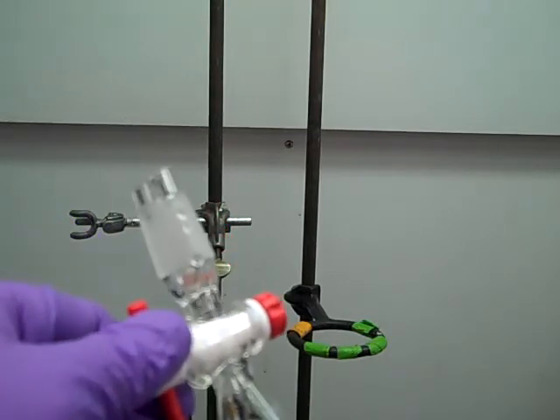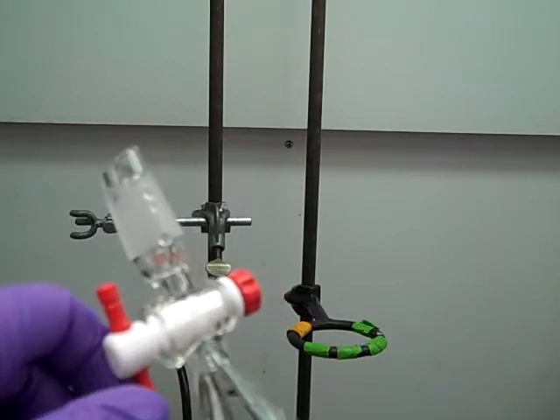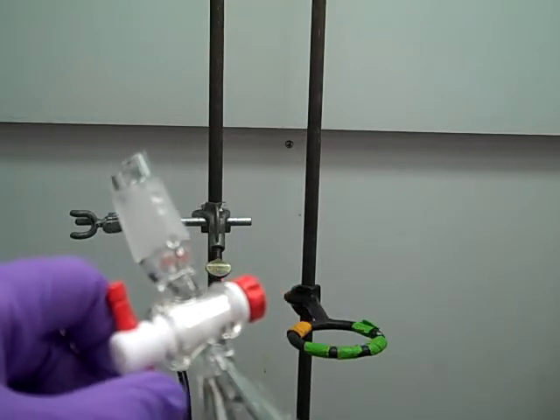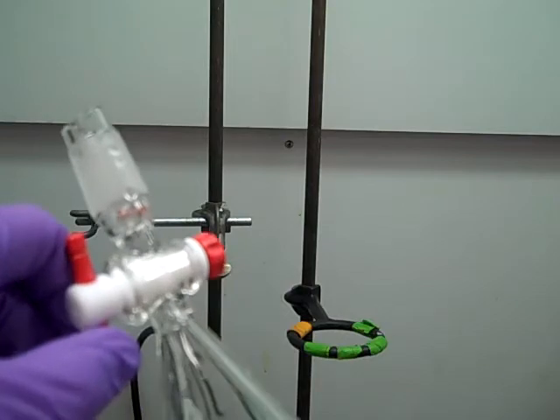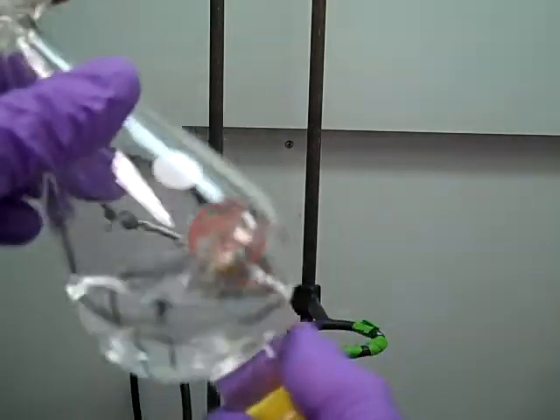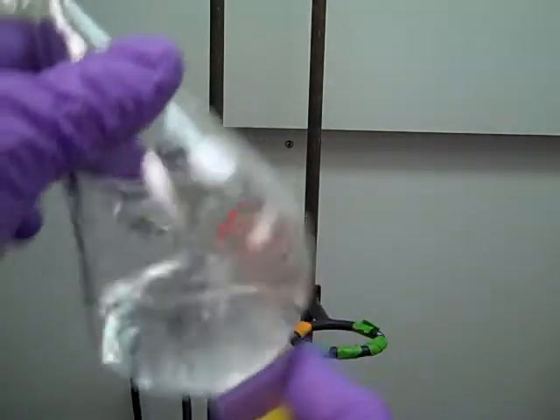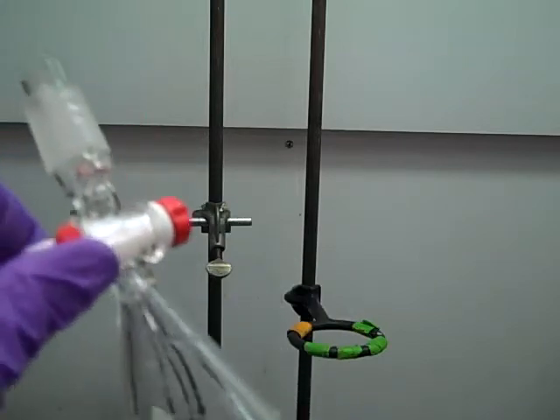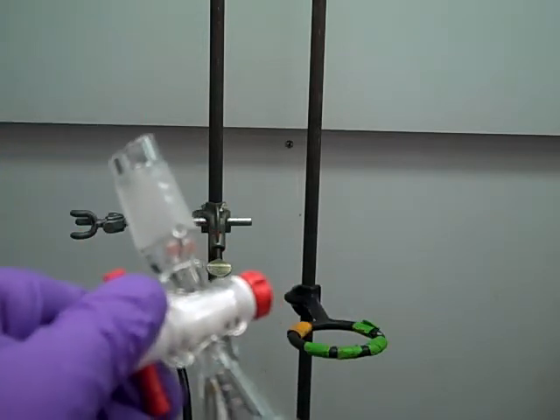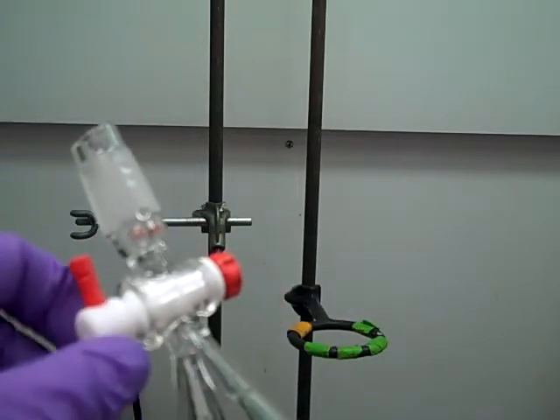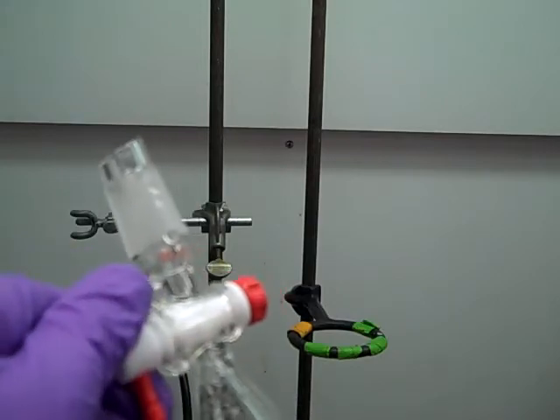And you might have heard that a little bit of gas just released. And that gas releasing process is called venting. So what we're going to do is shake up our separatory funnel little bit by little bit and then vent it. So every time we do that, we build up a little bit of pressure inside the separatory funnel. We open it up and vent it.